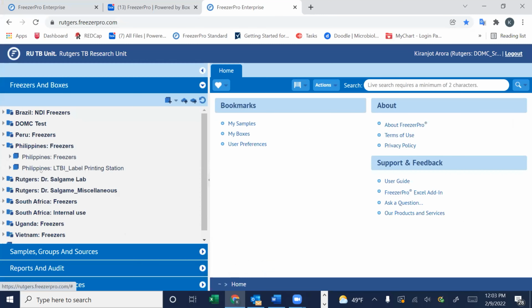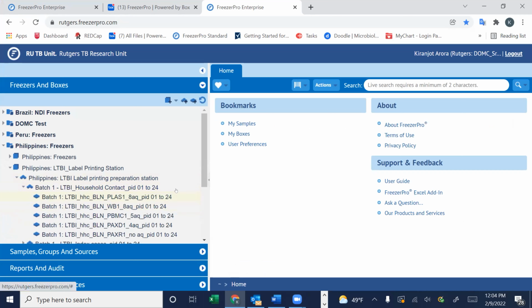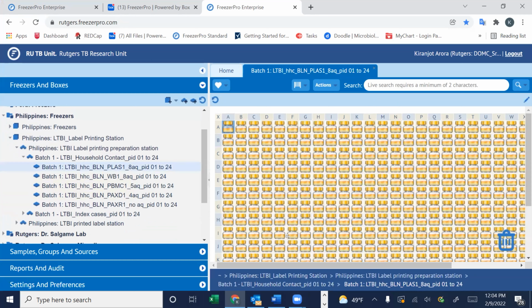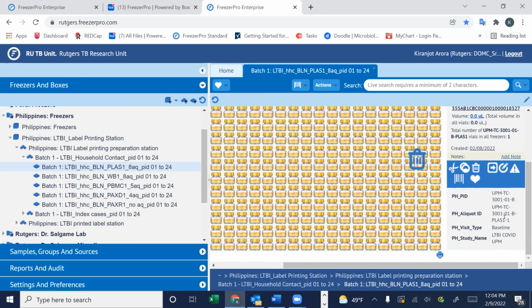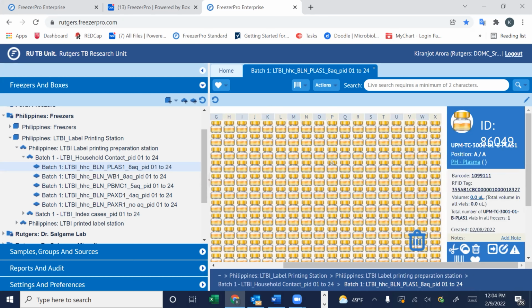this video is that bulk samples were uploaded for printing, and we want to change the name of all the samples in the aliquot ID variable as well as in the sample name variable. So just for demonstration purposes, here is the aliquot ID. It's 300101B dash PLAS1. So for all of the samples that are collected in baseline, we would also like to add visit type information in the aliquot ID name as well as in the sample name over here.